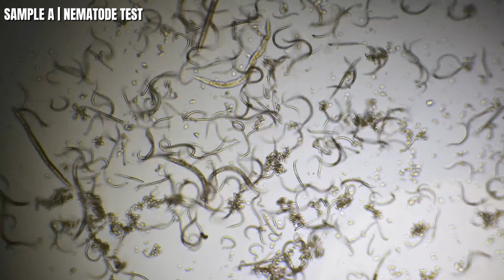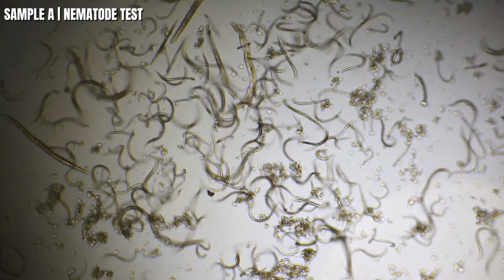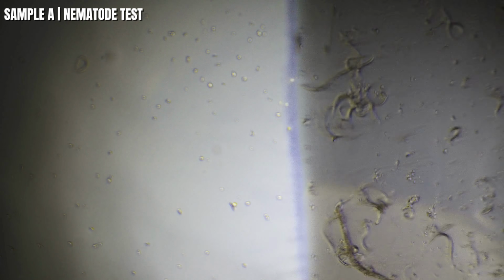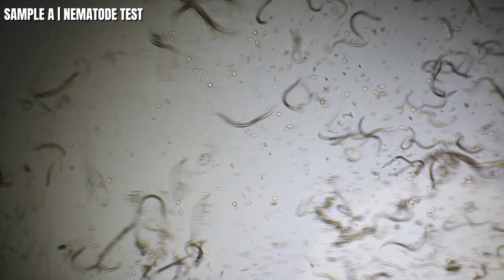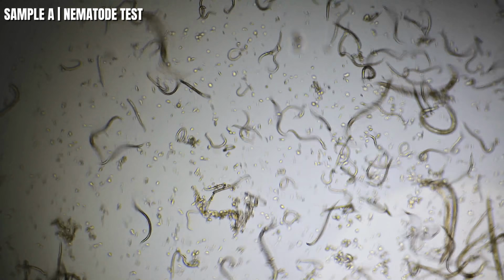Okay, here comes 1 drop of sample A liquor, hard liquor, right on top of them. So here it comes, guys, watch. And boom, right there. So let me focus, let me find out where they're at, let me move over a little bit. And they've just now been subjected to sample A's whiskey. Let's see how they do.